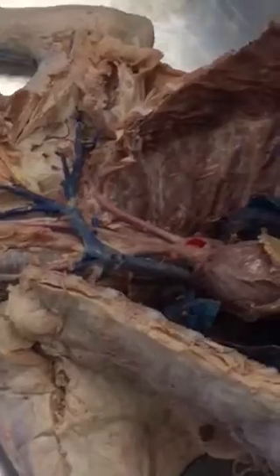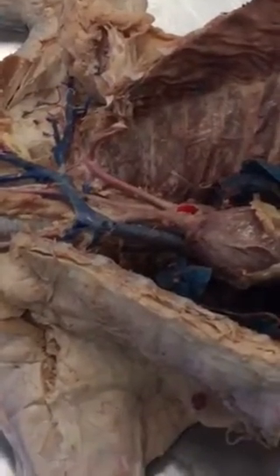The radial goes to your big finger. That's down here. We don't dissect down here. Okay. The radial goes to your big finger, and the ulnar goes to your little finger. What is this one? Do we need to know this one? No, that's just the branch that helps you determine where it stops and where it starts. Again, your brachial is between the underarm and the elbow. Okay.